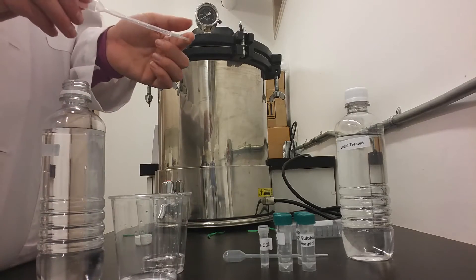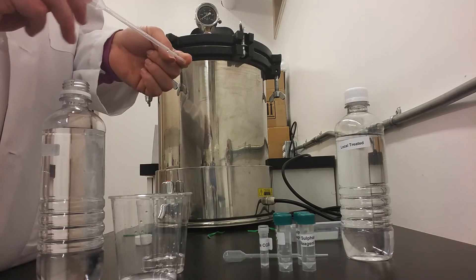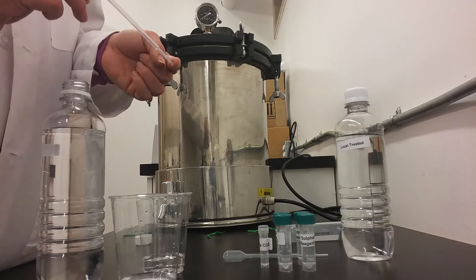It is important to keep the pipettes being used for each separate cup separate and to only use them in their own cup.